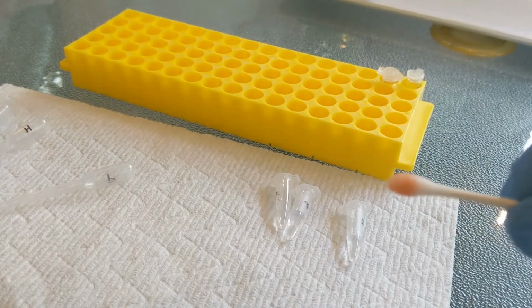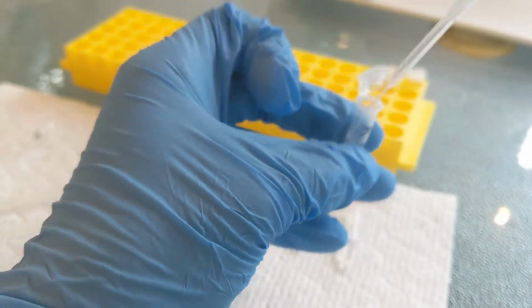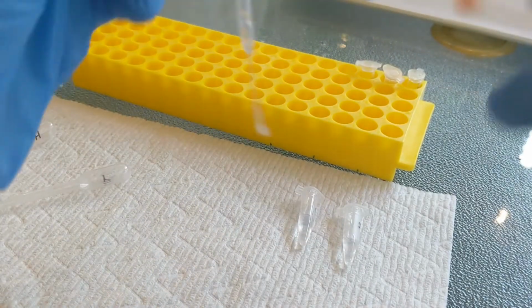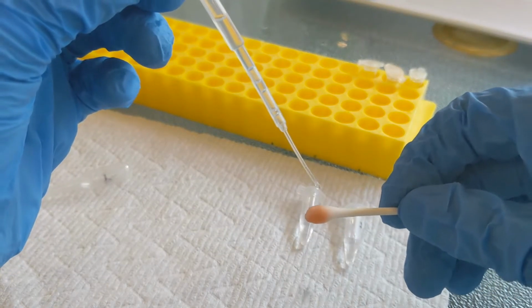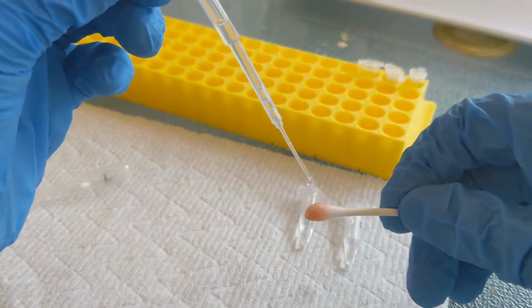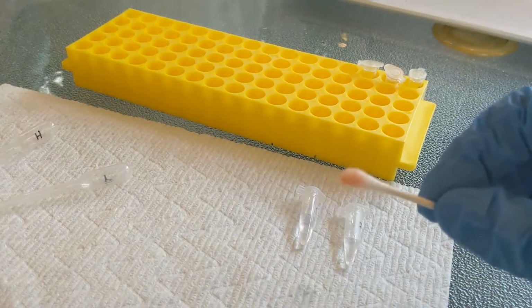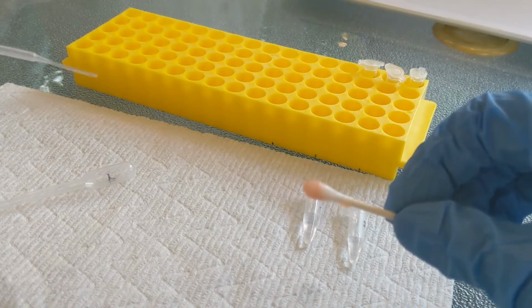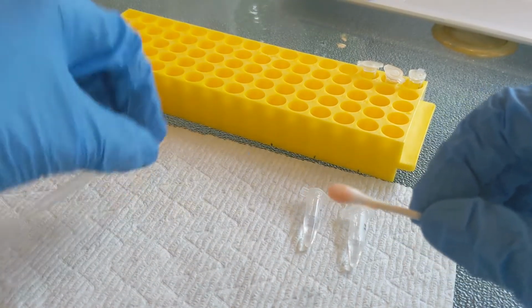The next thing that we're going to add is the alcohol. So that's the one that has an A for alcohol. And you're supposed to add 40 microliters or a couple of drops of alcohol. So this doesn't have to be a super precise amount, so we're going to just use the transfer pipette. Make sure it does not touch the end because you don't want to cross-contaminate when you use the same pipette for your next sample. So I just put a few drops of alcohol onto the end, and that's to break open the cells and let the hemoglobin out of the red blood cells, because the hemoglobin is what the other chemicals are going to detect.